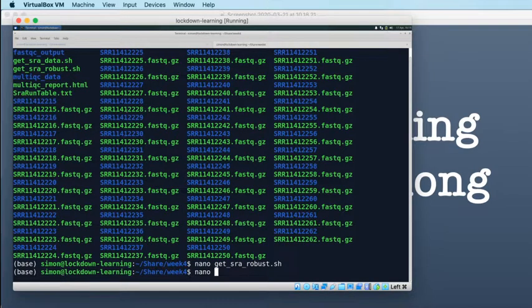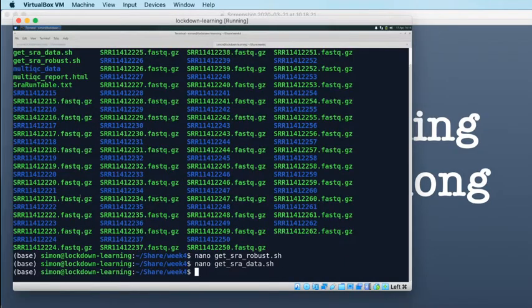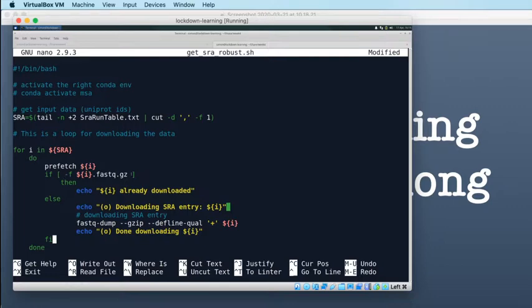So nano get SRA data. So here's my if. So I will borrow this, copy, and then exit, and then go back to the other script and paste it in there. There we go. So if the FastQ file exists, then do nothing effectively.